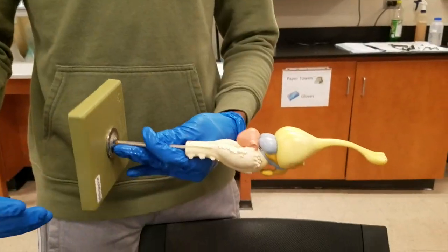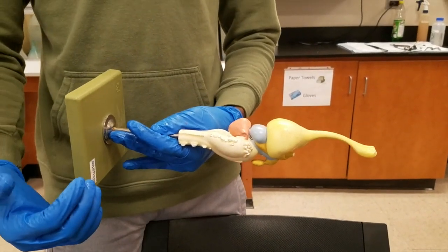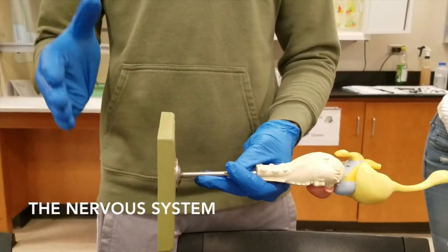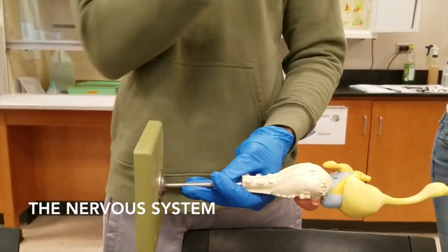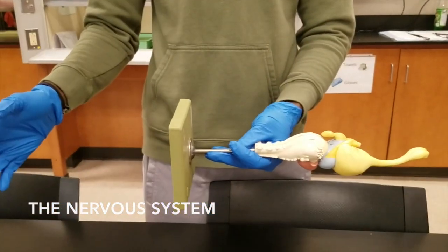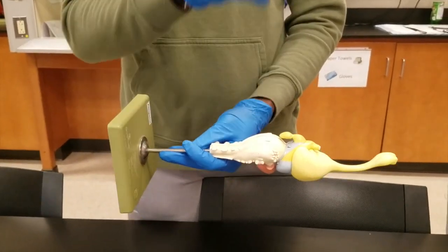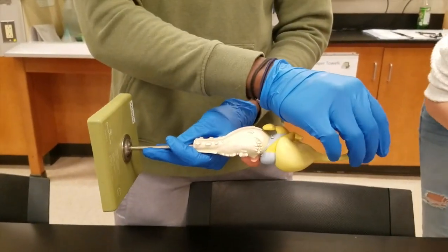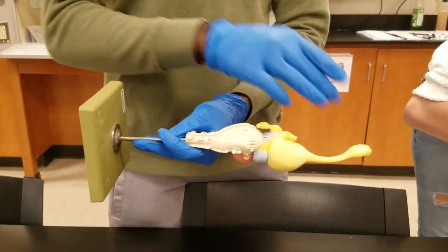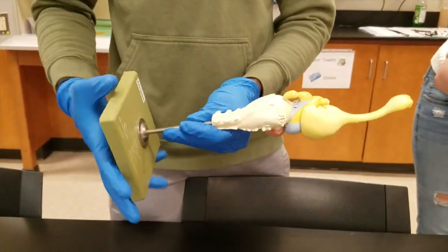This is the alligator brain, and it's really similar to the turtle brain in structure. Going from the anterior to posterior region, first we have the olfactory sac and olfactory lobe. These are responsible for processing scent.